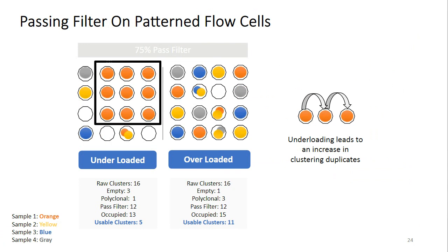An additional consideration with patterned flow cells is going to be the template duplicates. So you may have noticed that in the underloading example, there are a large number of orange clusters sitting in adjacent wells. These wells represent clustering duplicates, which are unique to patterned flow cells and result from the method that is used for cluster generation on the patterned flow cell.